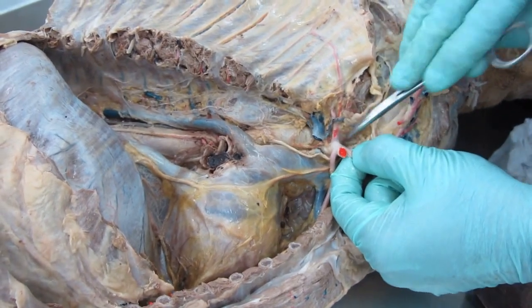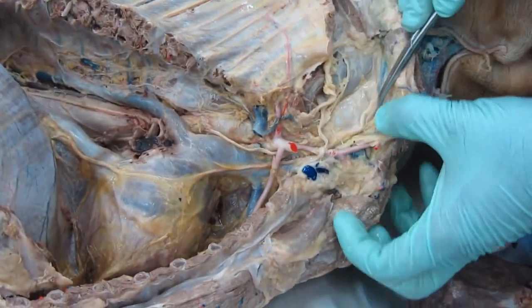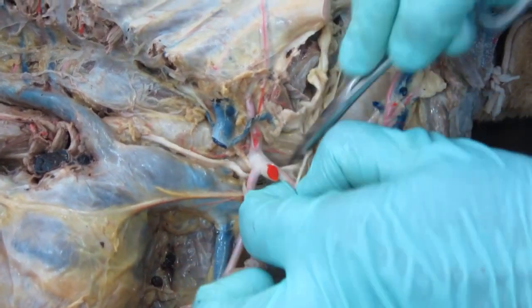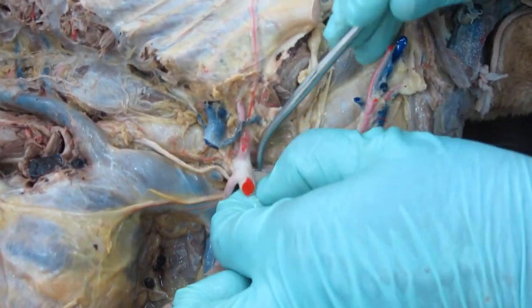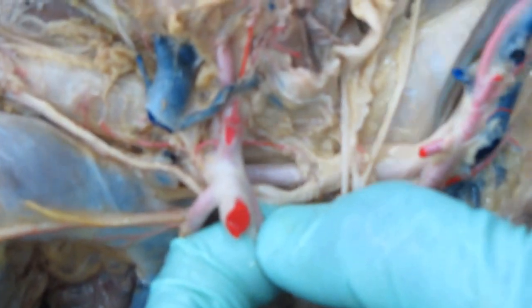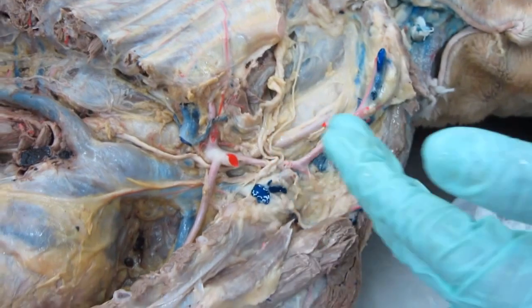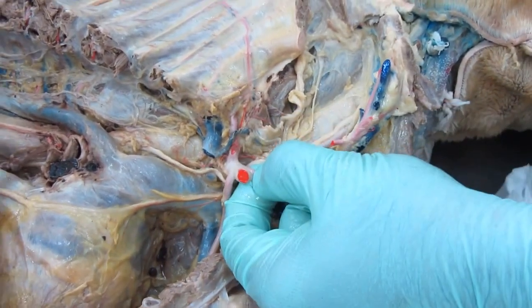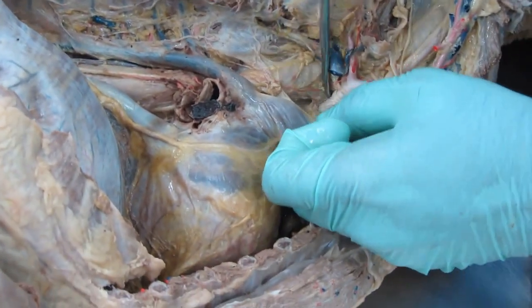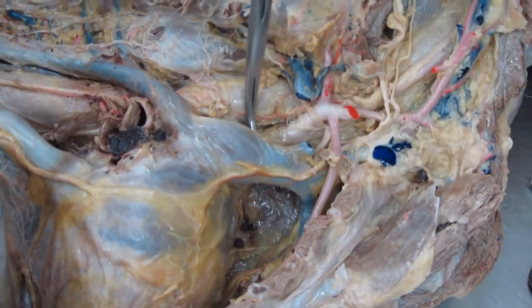After this, your brachiocephalic trunk is going to go further, as it will give off the right common carotid artery as well as the left common carotid artery. So we can look at that one. So that is the right common carotid, further going and would be wrapped by the carotid sheath. The left common carotid would arise before the right common carotid from the brachiocephalic trunk. So when I try to go a little deeper, that is my brachiocephalic trunk. The larger blood vessel that I see here is the brachiocephalic trunk coming off the aortic arch.